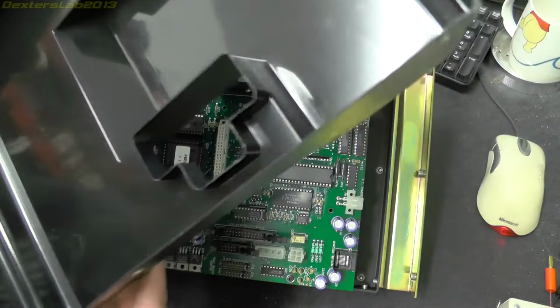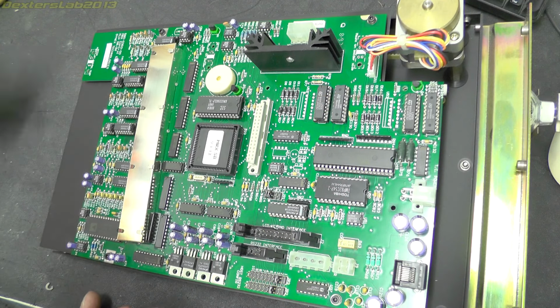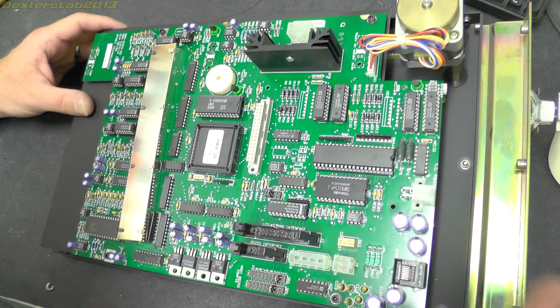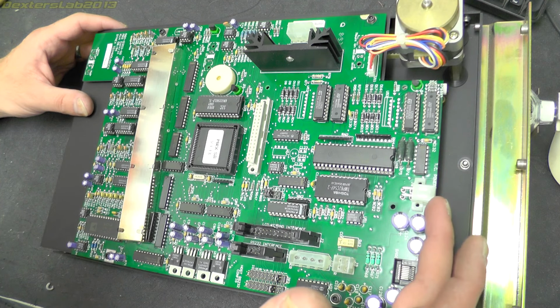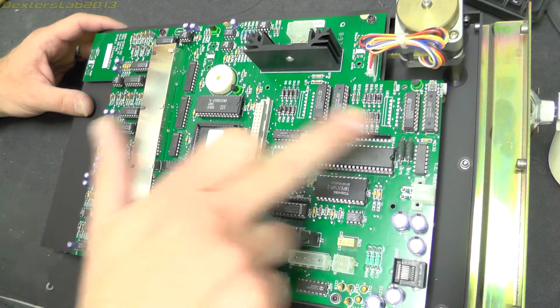So we've just got a cheap plastic lid. Yeah, there's a fair bit on here, to be honest. So let's start at the top. We've got a connector up here which is unused, which is called TC Power. Not sure what that would be. TC is normally thermocouple, but why would you need power? Could be thermoelectric cooler. That would need power, possibly. We've got a barcode option there, which is obviously unused on this model because there was nothing plugged into it. We'll have a look at the ICs in a moment.